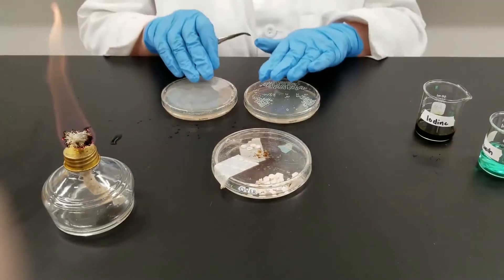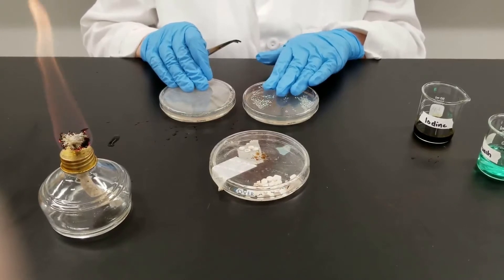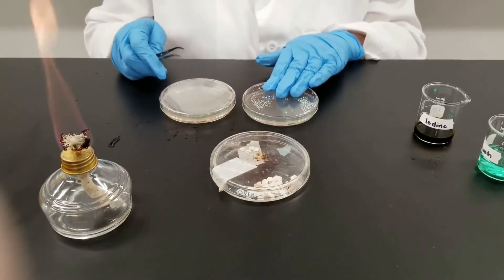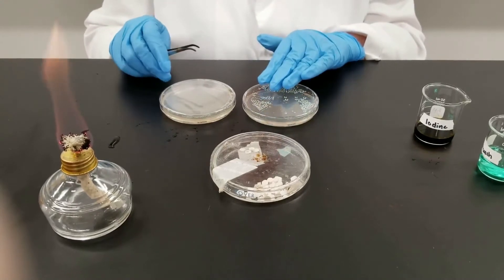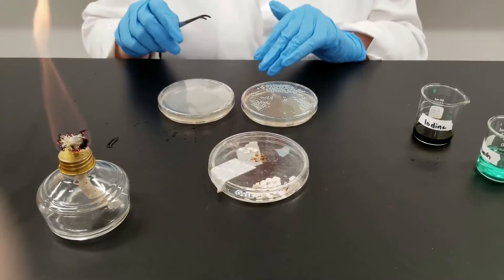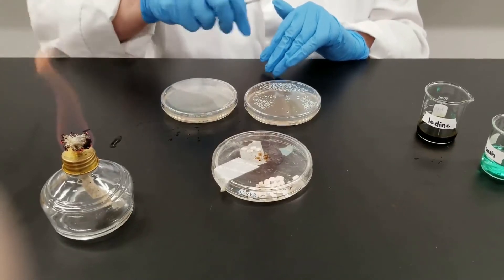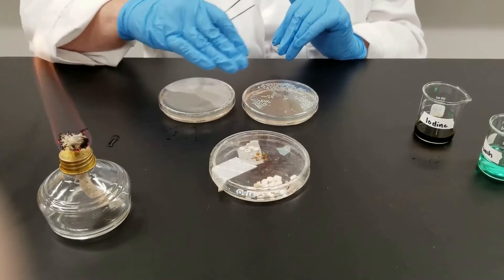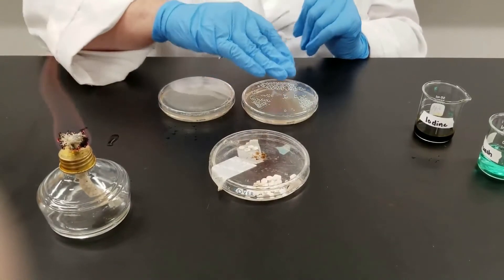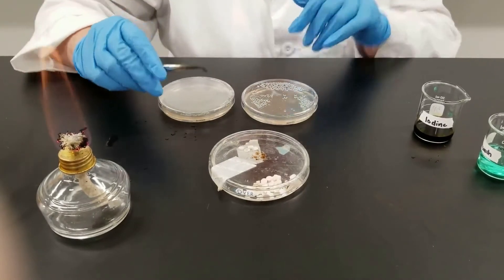I have already inoculated each of these plates — one with Staphylococcus aureus and the other one with Pseudomonas aeruginosa, so a gram positive and a gram negative. I inoculated them with a cotton swab to try to get a complete lawn of growth. We're not going for streak isolation; we want nice, complete, solid growth.